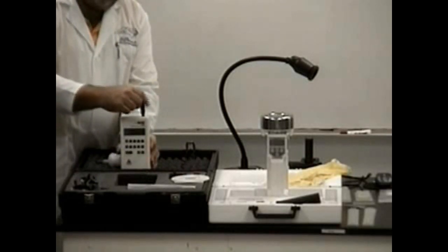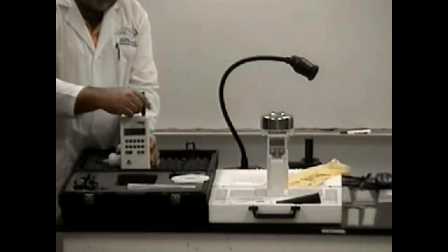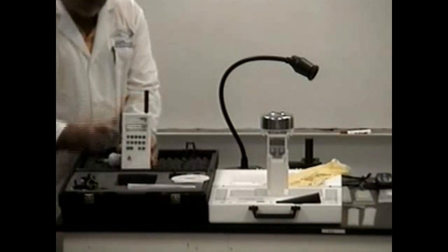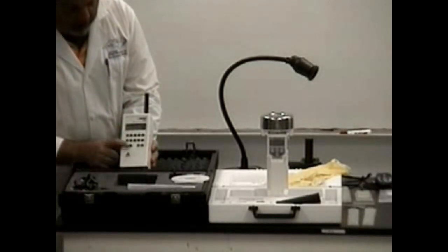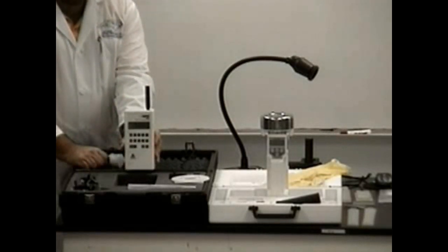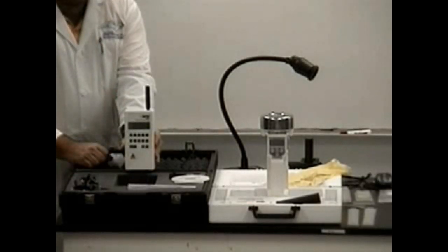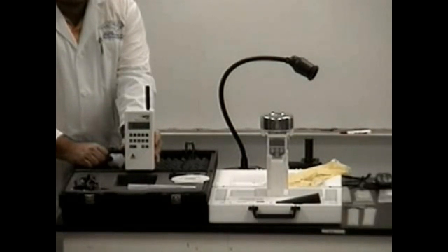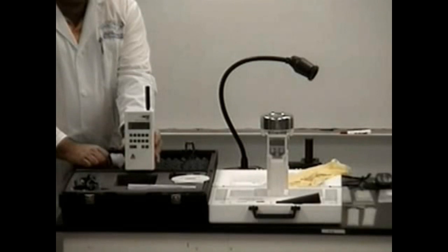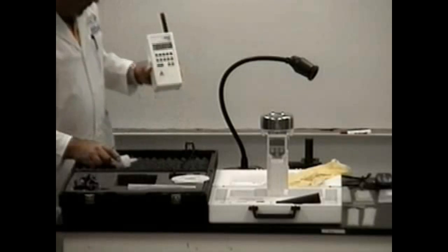To get the actual count of particles in the air, I will unscrew the filter and screw on the isokinetic probe, so it will pull through one-tenth of a cubic foot of air. I'll make sure it's set at 0.5 and start it. It will collect one-tenth of a cubic foot of air very simply and extrapolate to what the count would be in one cubic foot. It will also tell me the relative humidity and temperature of the room.